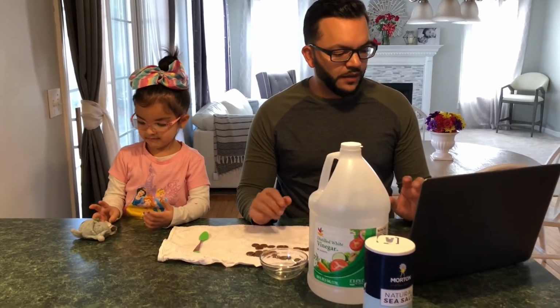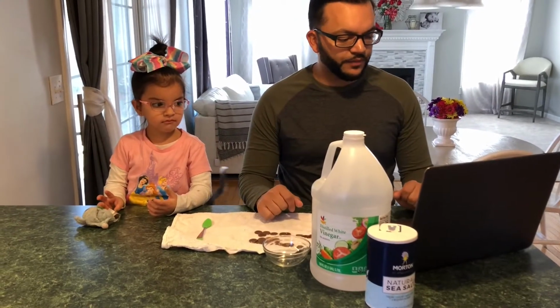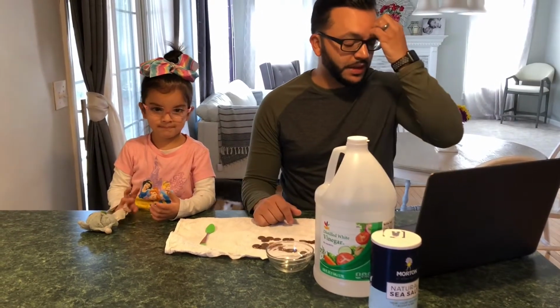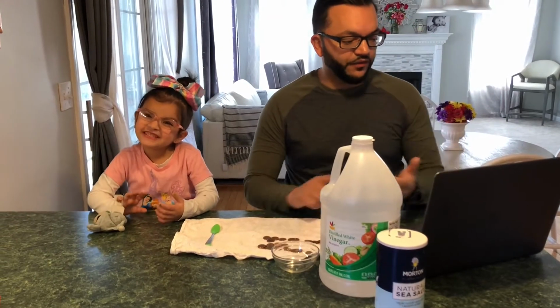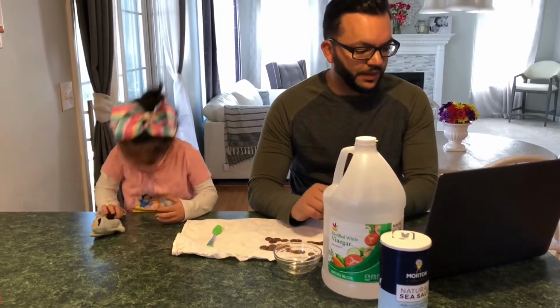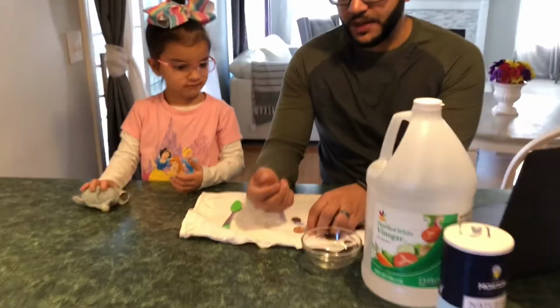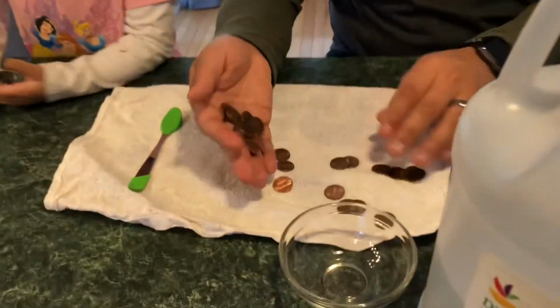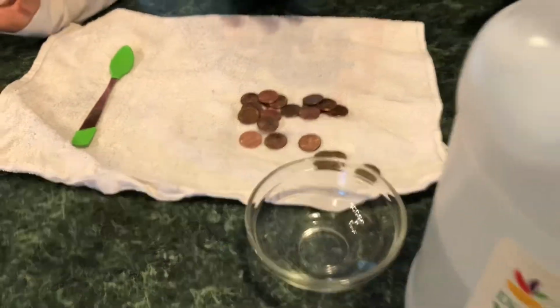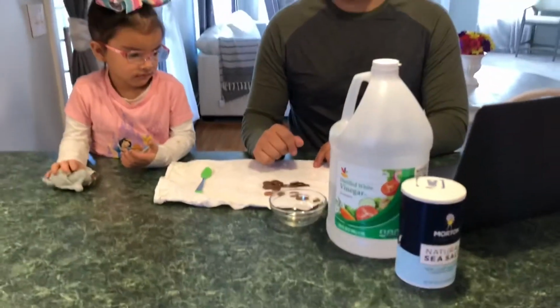Oxidation occurs when an atom in a molecule loses an electron, and that's kind of its basic chemical reaction. It's a fundamental chemical reaction that affects many things, both inside and out of the body. So today we're going to talk about pennies. Now, everybody knows pennies. We see pennies. They're filthy, they're dirty, and we almost never use them. But they do have value, most importantly, for an experiment.